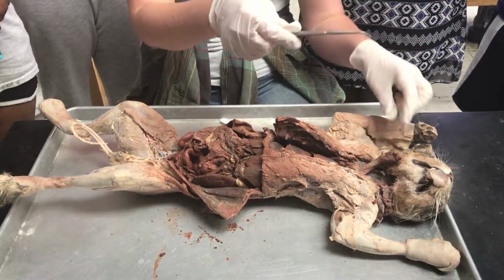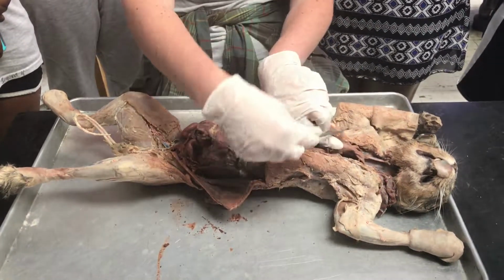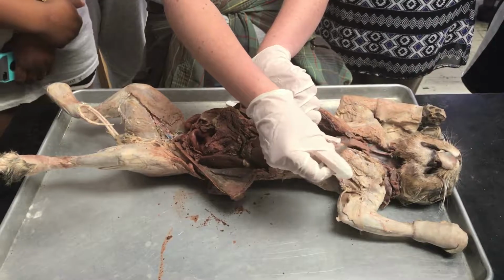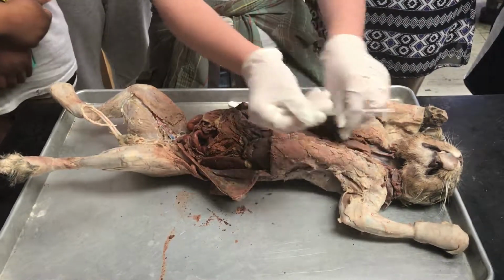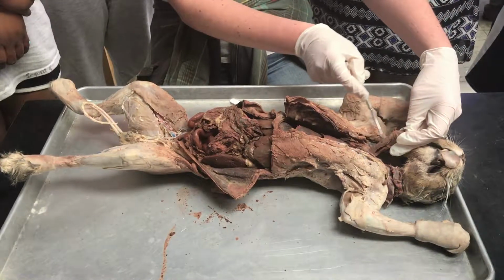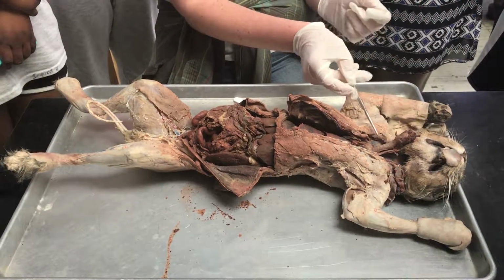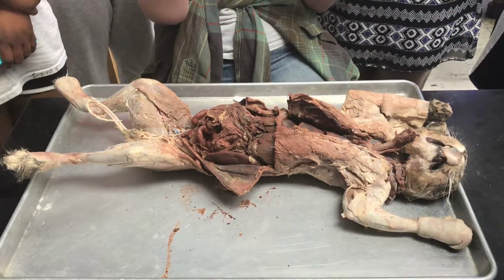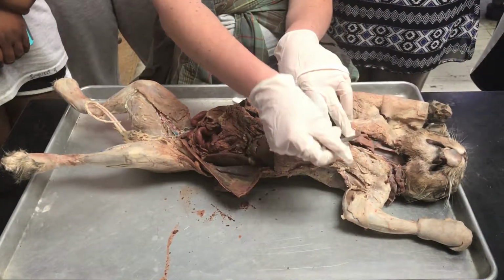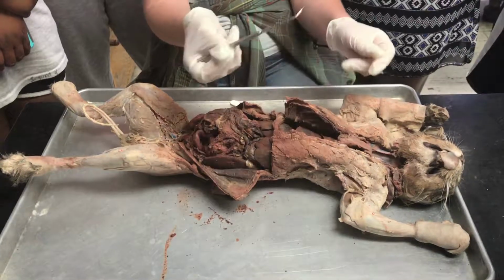And so after the pharynx, food is going to go into the esophagus, which is the back part right here. It's this thin, flat, muscular tube that sits behind the trachea. So the trachea is here. It's characterized by having these C rings that help maintain the integrity and the structure of the trachea. But the esophagus is going to be the one behind it, that thinner, flatter one.